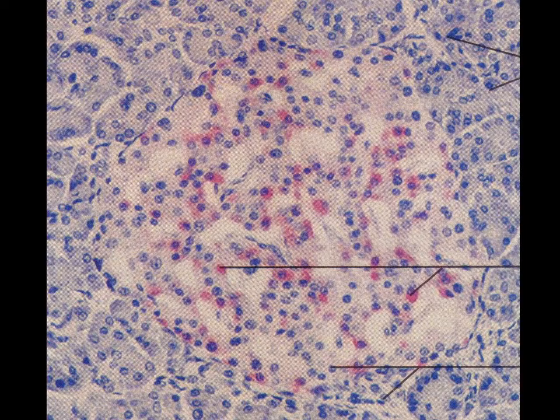We'll go to a little close-up here of one of those islets. And now stained a little bit differently, now we can see the differences in the cells that are actually inside the islet itself. And so once again, we've got blue cells and we've got red cells. And so this is going to go along the same kind of a naming scheme in a sense. Those that are blue, here's a blue color here, are beta cells. And those that are red are alpha.